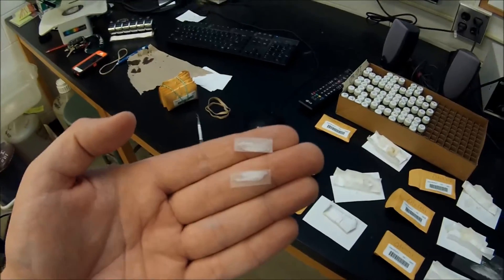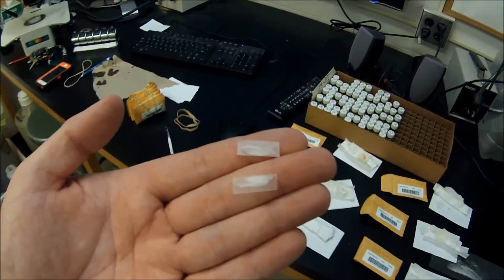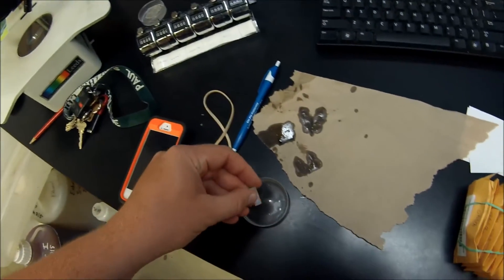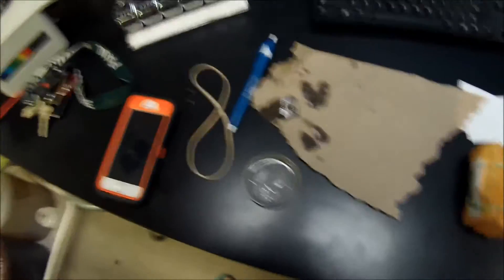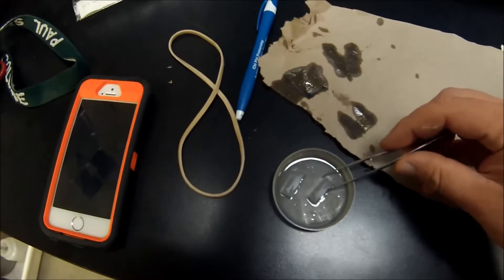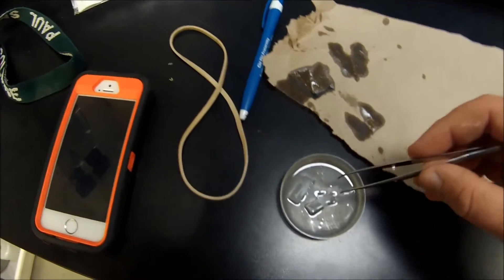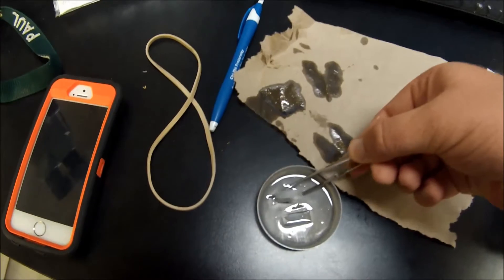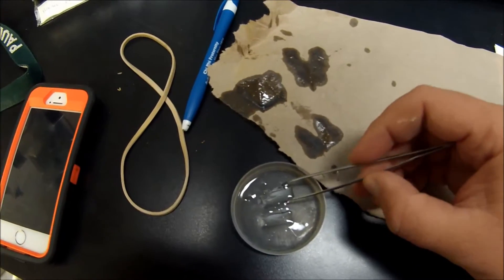So once we have two nice little cross-sections of the otolith here, we put it under a microscope and shine some light through it. So we're going to put it in this little tray here. We're going to put it in some immersion oil that will help the annuli stand out a little bit better, as you can see here. And then we put it under a microscope.